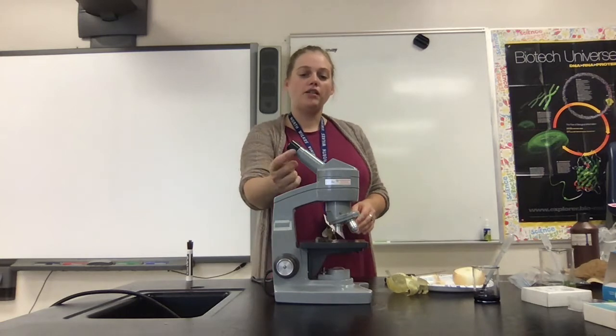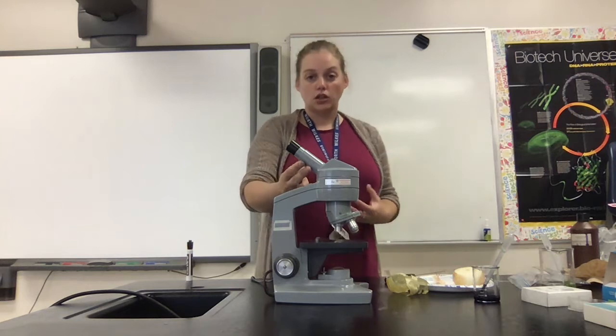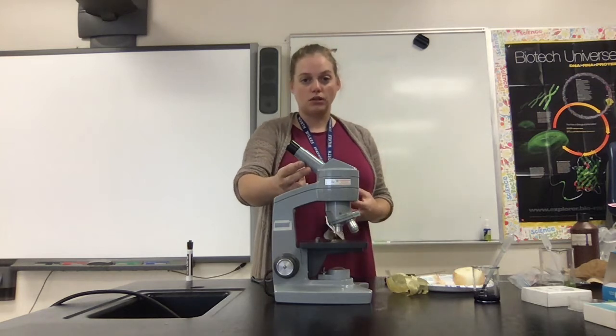Microscopes have a piece called the eyepiece, and eyepieces have lenses in them. The lens is going to magnify something to be bigger than it normally is. All of the microscopes that we have in this school have an eyepiece with a lens that can magnify something to be 10 times larger than it normally is.